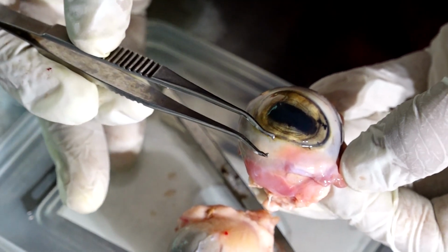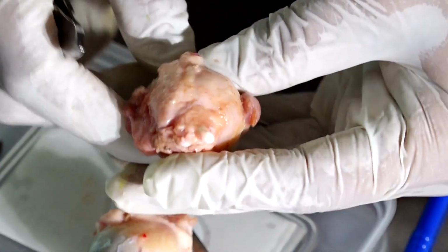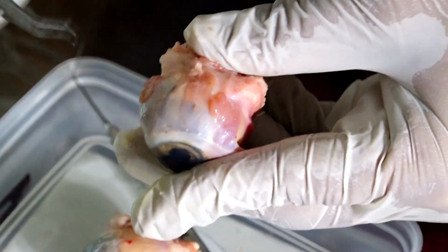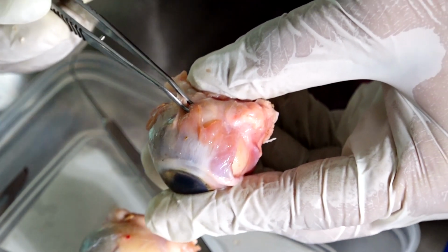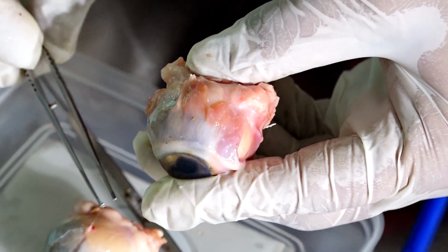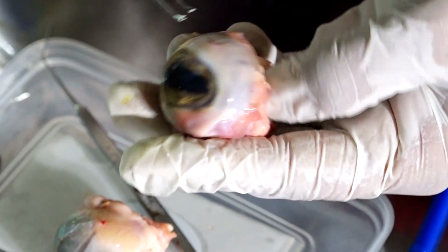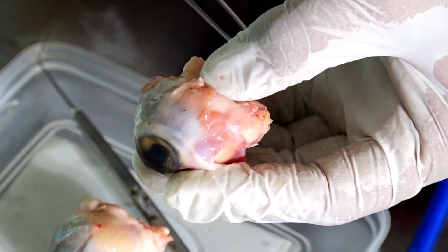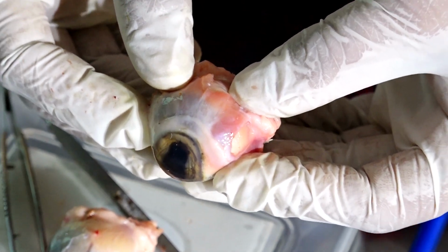Are there any other extraocular muscles? Oblique muscles. Oblique muscles are attached here, very close to the optic nerve. This is the oblique muscle attachment. So there are two oblique muscles. Can you tell me which are the two oblique muscles? Inferior. Is there a lateral oblique and medial oblique also? No. So there are only 6 extraocular muscles: superior rectus, inferior rectus, lateral rectus, medial rectus, superior oblique and inferior oblique. These are the 6 extraocular muscles which are attached to the sclera.